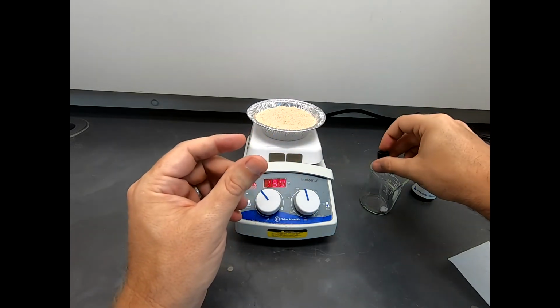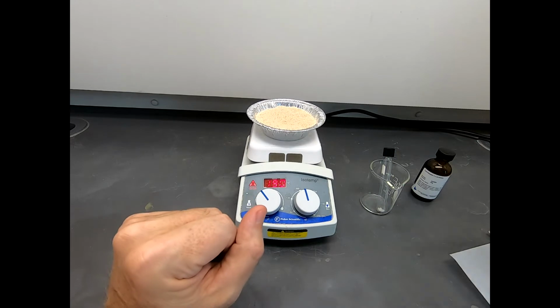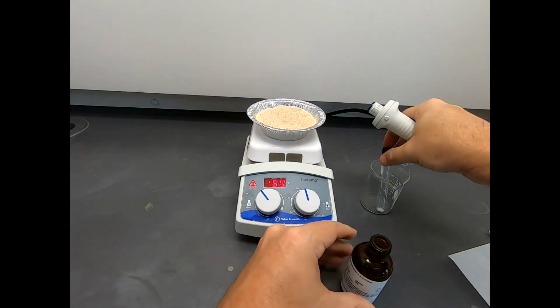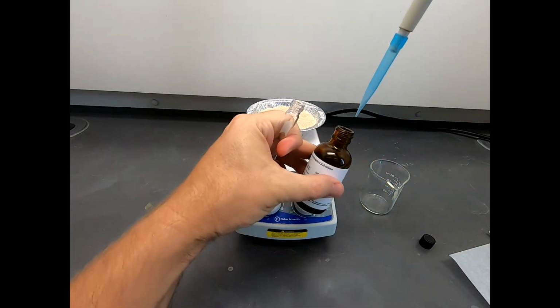Now we need to add to our reaction flask our cycloheptatriene. So I'm going to add this as a liquid, and I need 208 microliters of this. So we'll just use a pipetter.